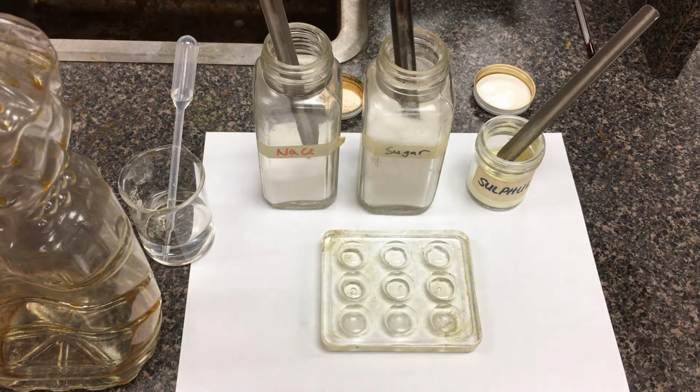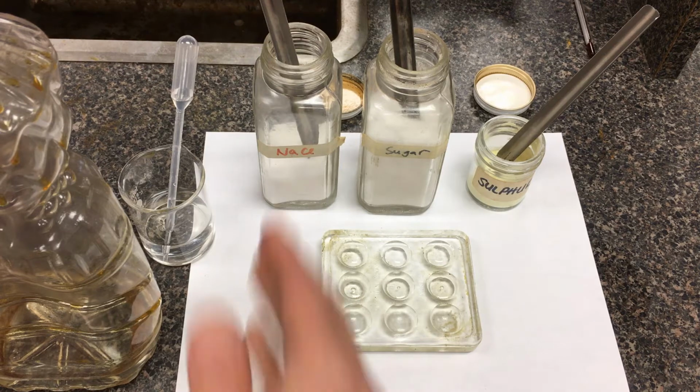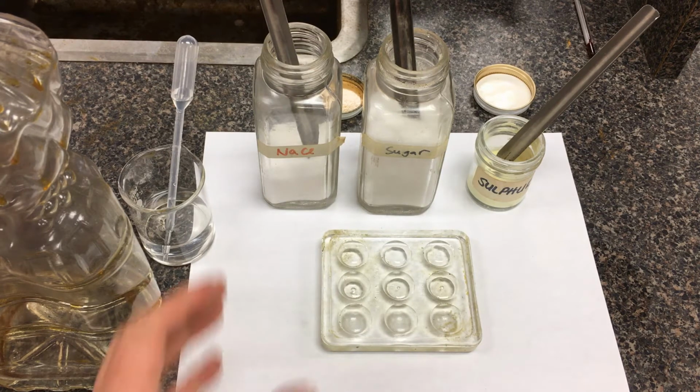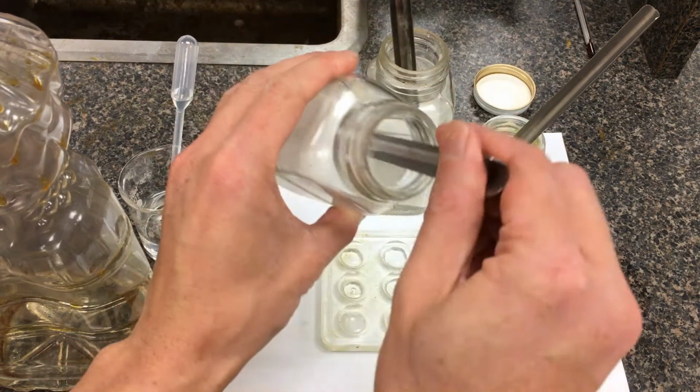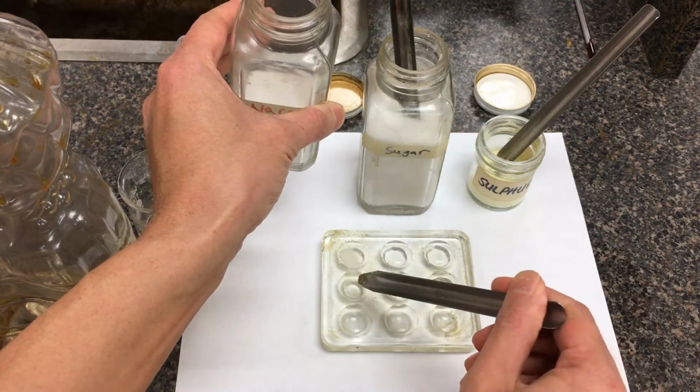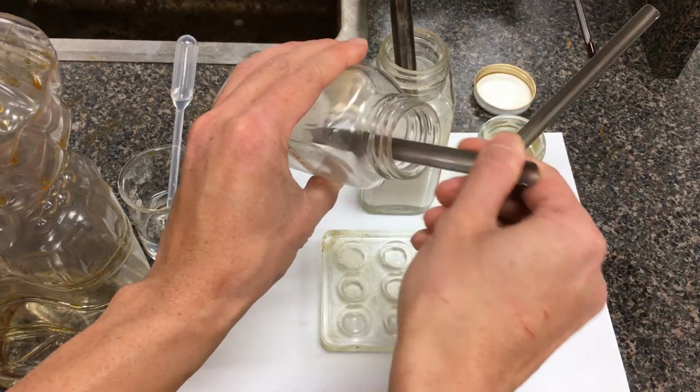And again, what we're going to be testing here is the solubility of different solids, ranging from ionic compounds. Sugar is polar covalent, and sulfur is nonpolar. We're going to cross-match it in these solvents to see whether it's soluble or not soluble. So let's just take this salt here, just table salt, NaCl. Just going to add a little bit into each of these containers here.